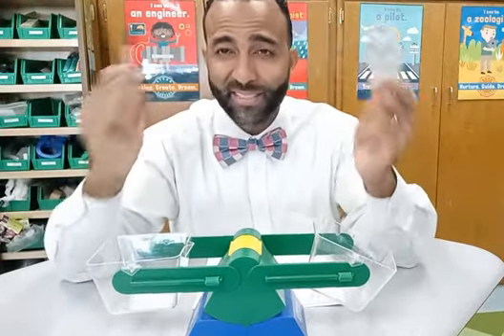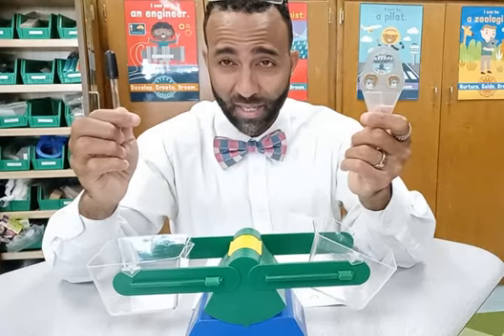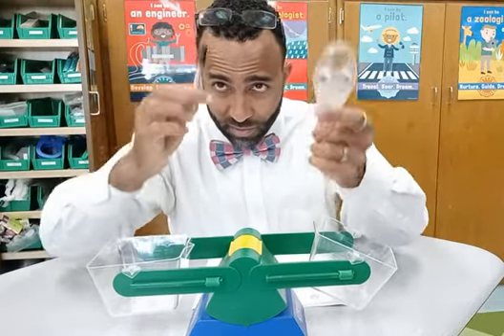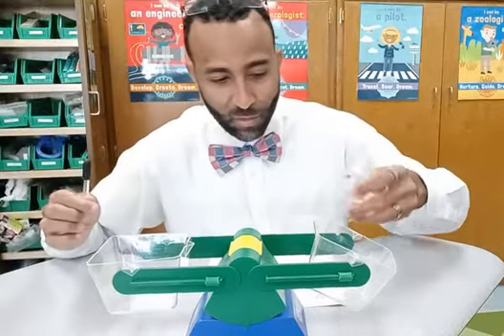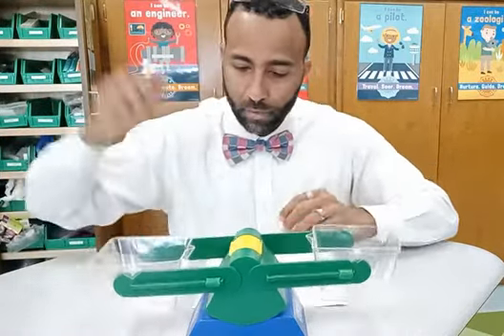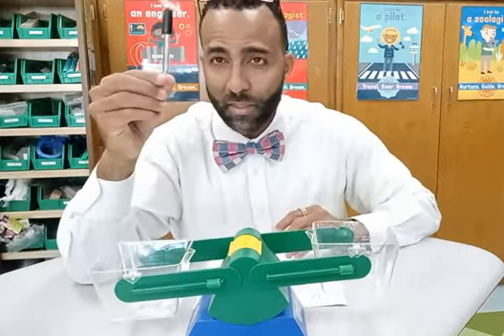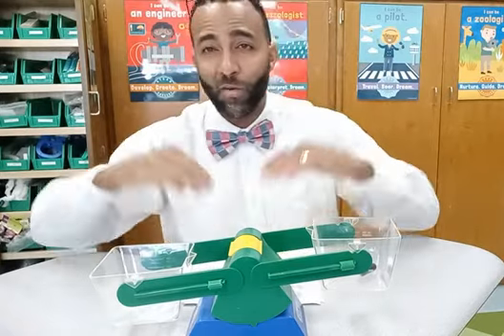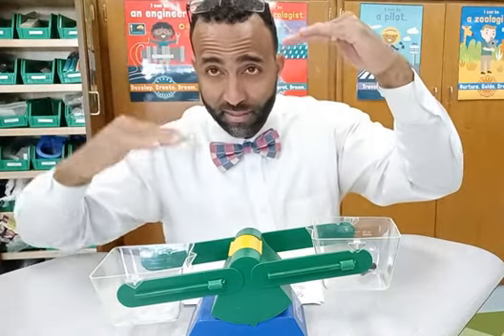Both of these are amazing scientific tools. Let's go for it. I'm going to choose hand lens going first. All right, I'm going to put it on the right this time. Hand lens is down. Time for my pipette. Oh, wow. So the hand lens is here.